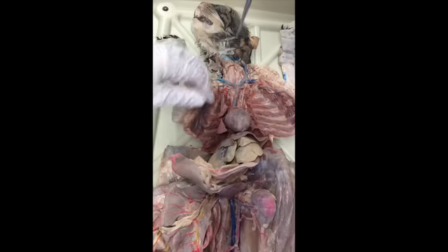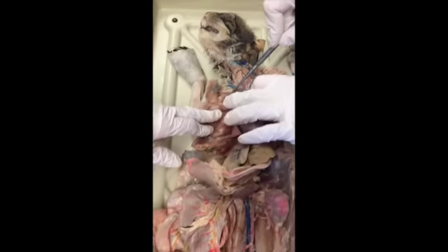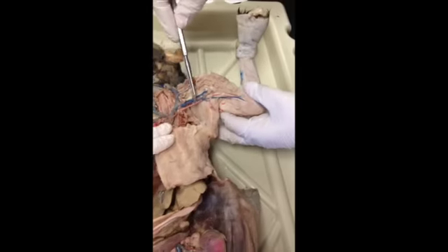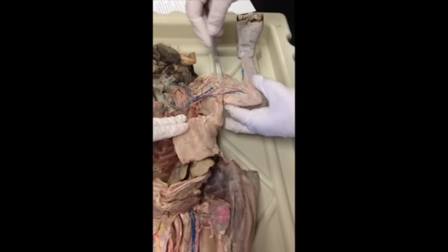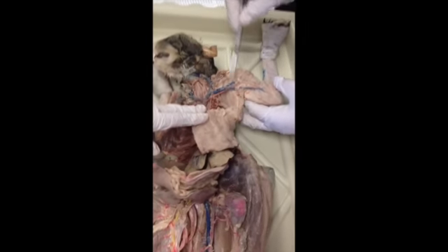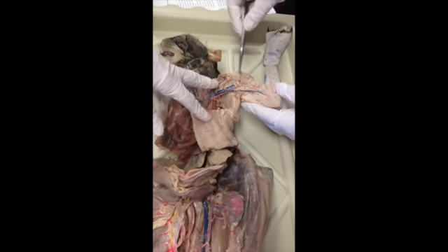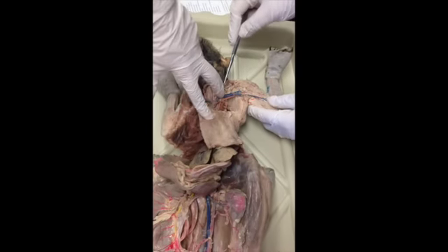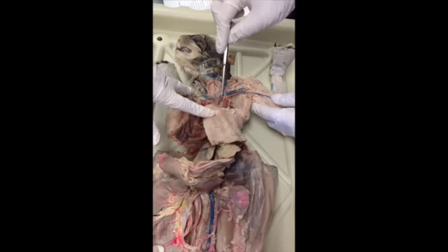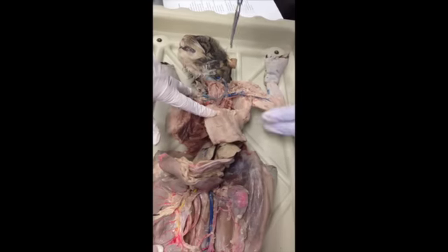Let's see, what else we need to know. Okay, so brachiocephalic at the branch becomes axillary. Yep, and let's do this side. So here's our branch, here's our axillary, here's another branch. This is where the brachial vein starts. So between the branches, the axillary, think armpit, then brachial, which means arm. And then the subclavian. Where's the subclavian? It's closer than the brachial. Okay. So brachiocephalic, subclavian, axillary, brachial. Sorry if I confused you there.